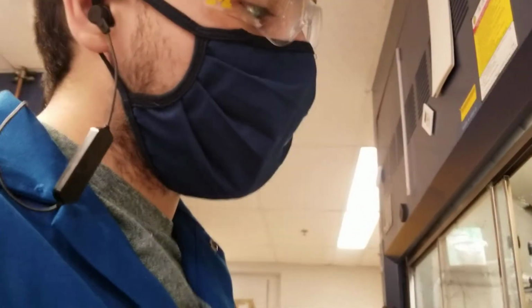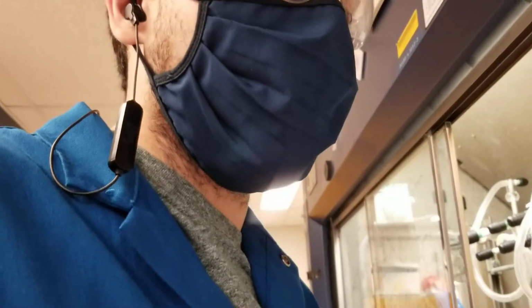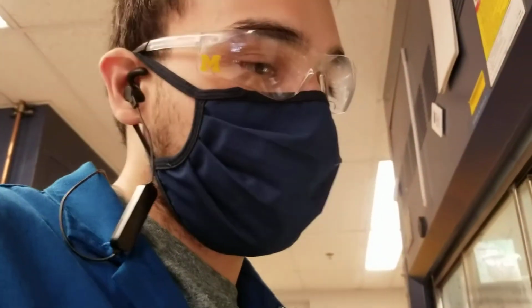Today I have some interesting things to show you, and that is what it's like when we go to work up chemical reactions. And when we say work up, that means once our chemical process is complete, how do we handle the material? And how do we end up purifying that material, and what considerations do we have to make?